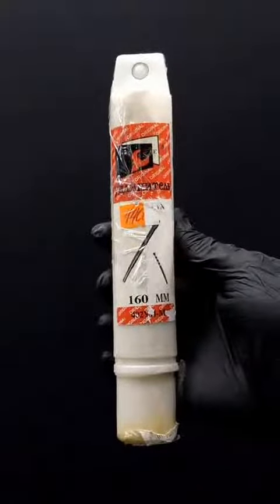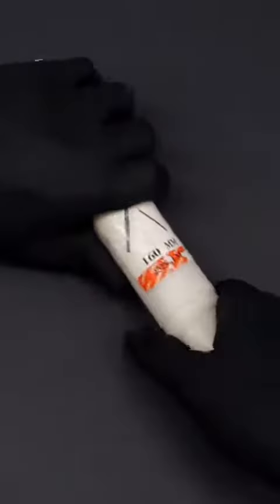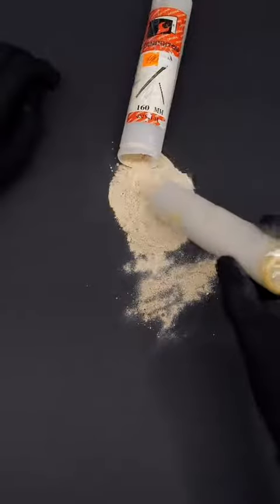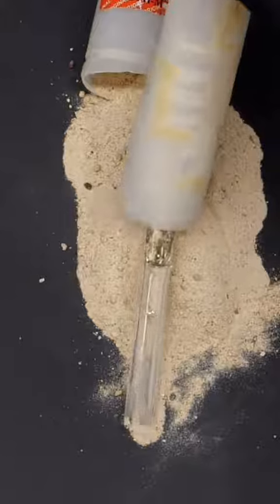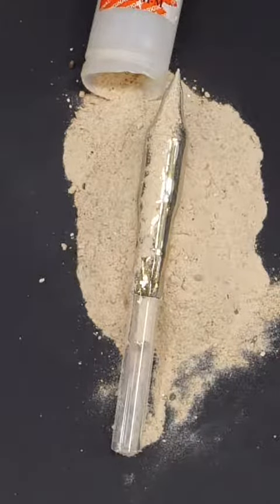A while ago, I bought this little tube from Russia, and I think it's finally time to crack it open. Inside of it, besides all the sand, is some nice cesium metal.